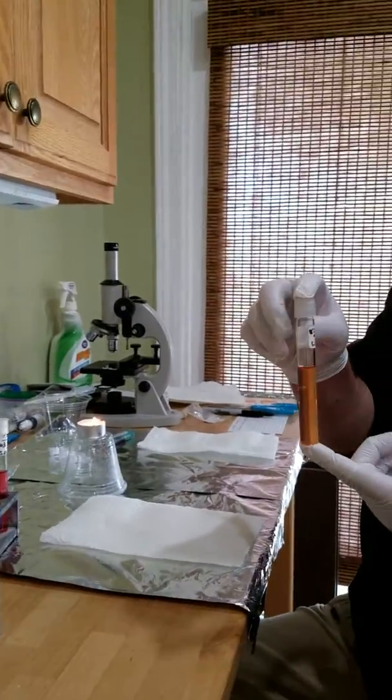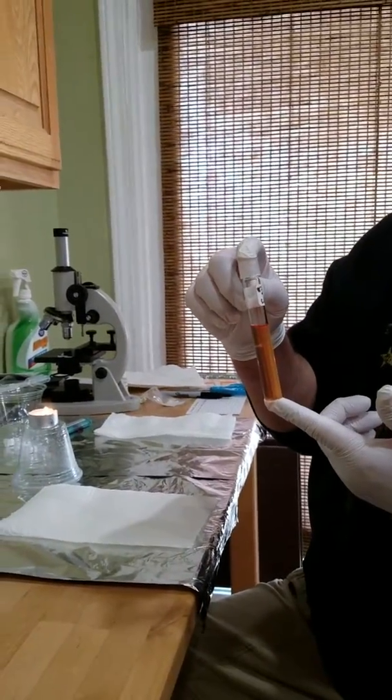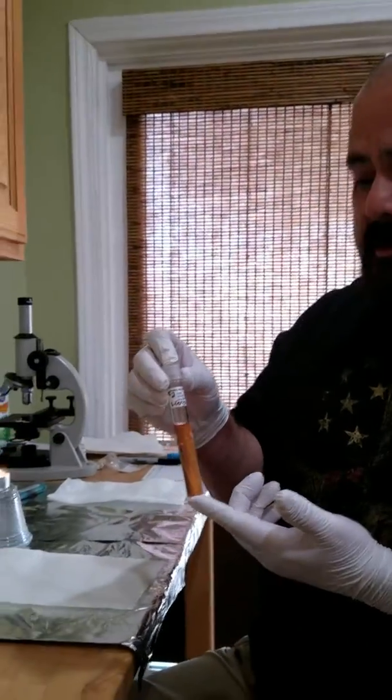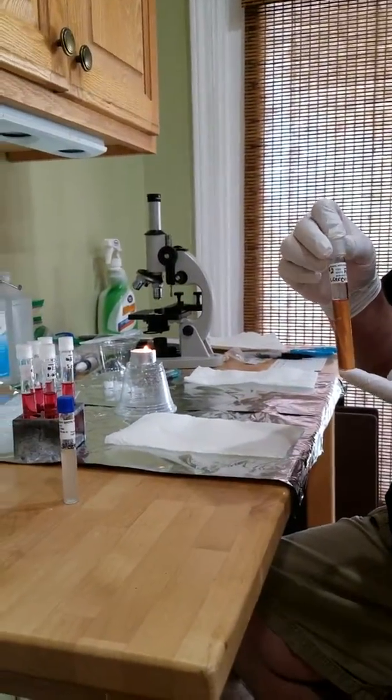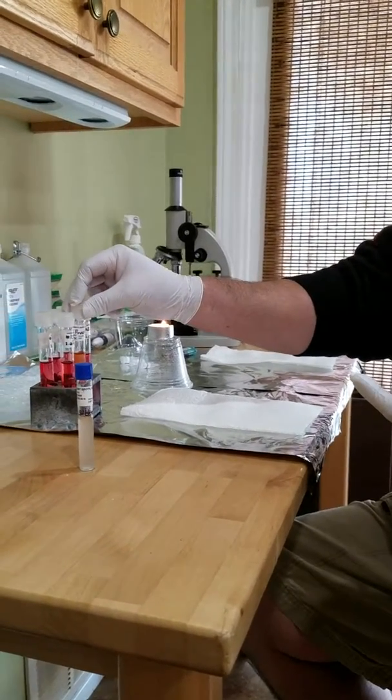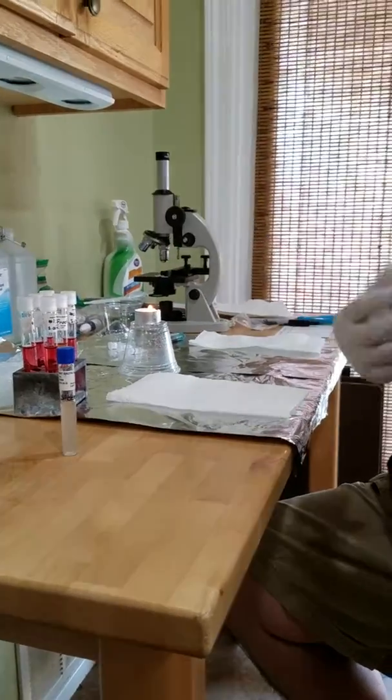Now I do want to point out, I pulled out my 3 test tubes, and one of my test tubes obviously has already, the pH is obviously wrong, so something happened on shipment or when they first made these. I haven't done anything. They've been in their case, the same way I received them, but we're going to do it anyway because this is what I have, and I'll still see if my color changes, if I catch any gas in the Durham tube, and so on. I know that kind of messes up my experiment, but we'll do the best we can with what we have.